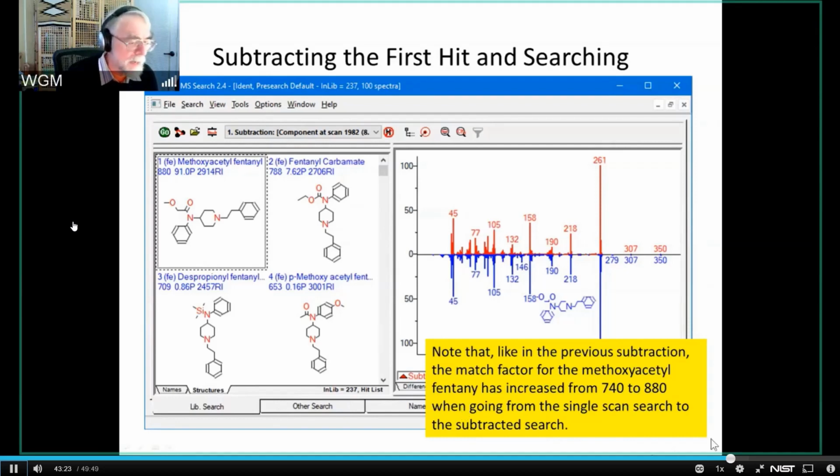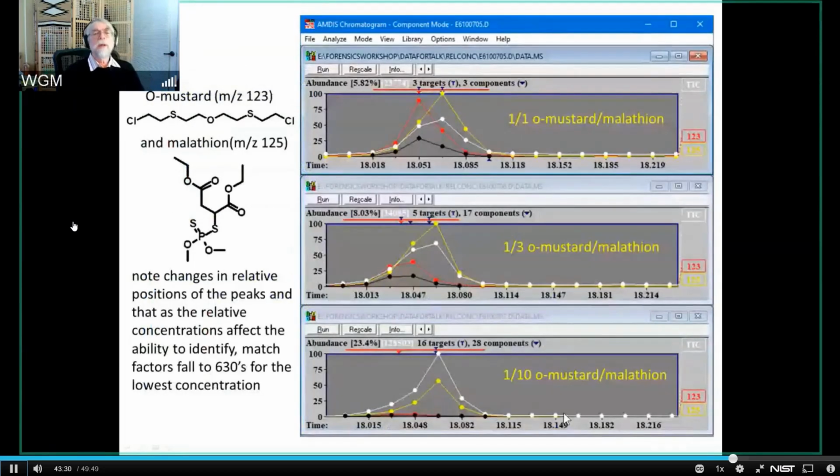Now, I just have a couple minutes before we're going to break for lunch, and I wanted just to cover a couple of other things that come up within the context of things overlapping, and that's the role of concentration. This is a mixture of O-mustard, which is a chemical warfare agent, and malathion, which, if you're an insect, is a chemical warfare agent. I start out with a 1-to-1 concentration of the two, and go to 1-to-3 and 1-to-10. And what you see, I'm showing you the 123 ion and the 125. The 125 comes from the malathion. The 123 comes from the O-mustard.